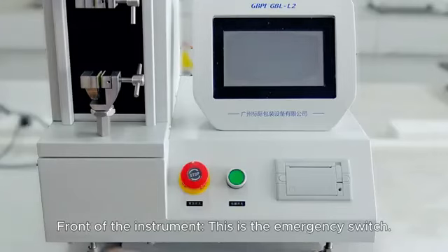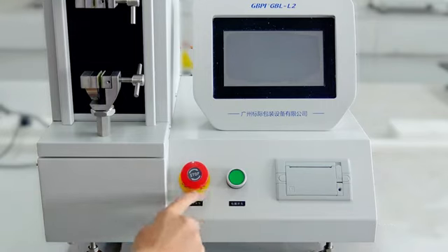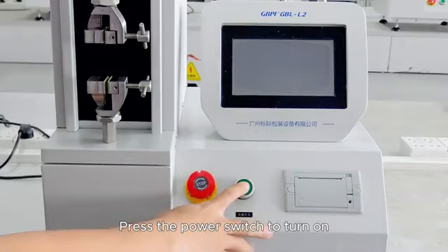Front of the instrument, this is the emergency switch. In an emergency, press it and the instrument will power off. This is the power switch of the instrument. This is a micro printer. Press the power switch to turn on.